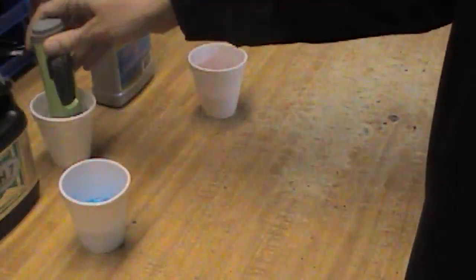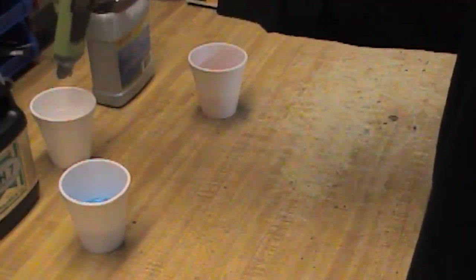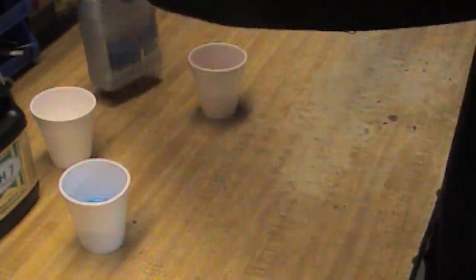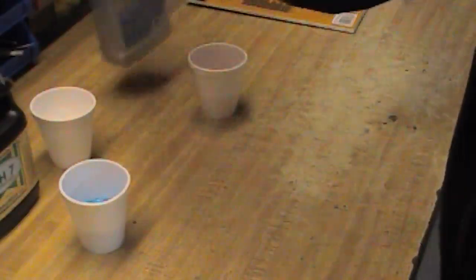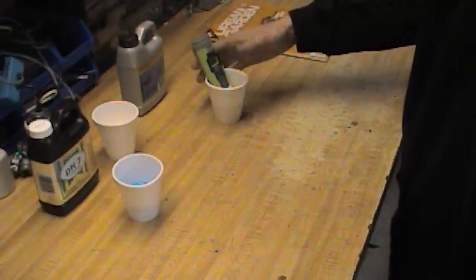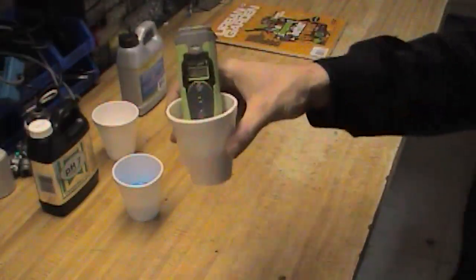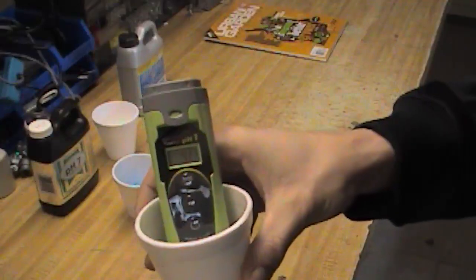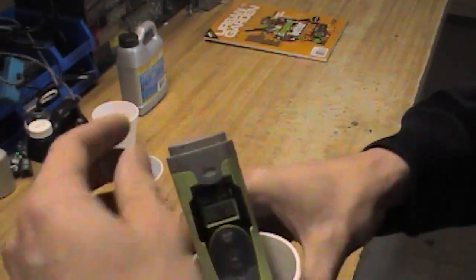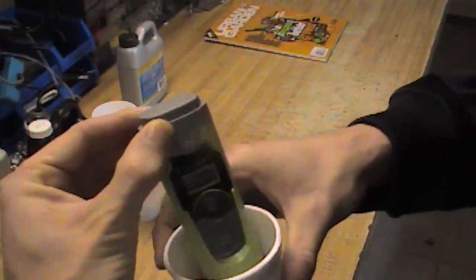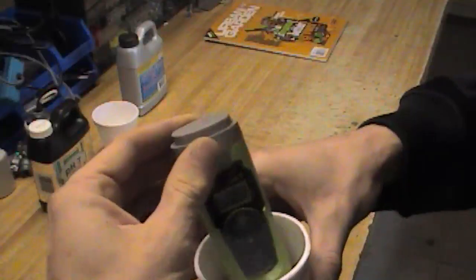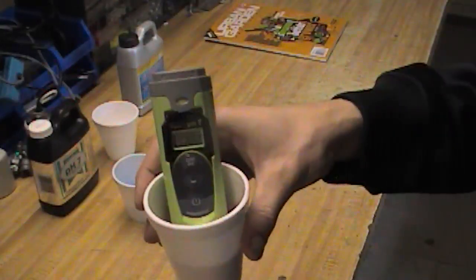I'm going to rinse it off in some regular tap water here, give it a quick wipe. Now it's time for the pH 4 buffer solution. Put it into the 4. Looks like we've got 4.3, 4.2, bit of a stir, 4.1, 4.0. It's sitting on 4.0.